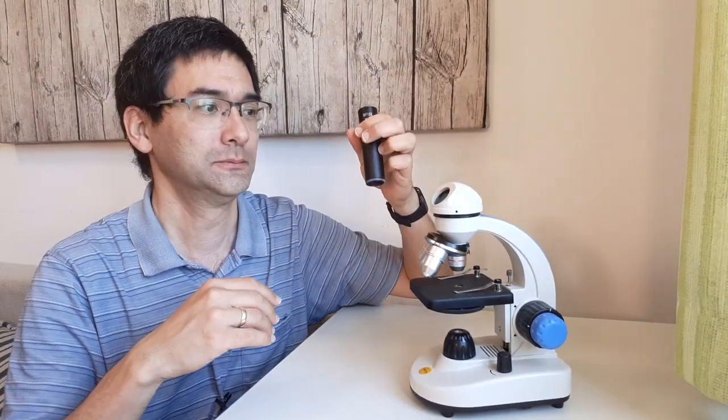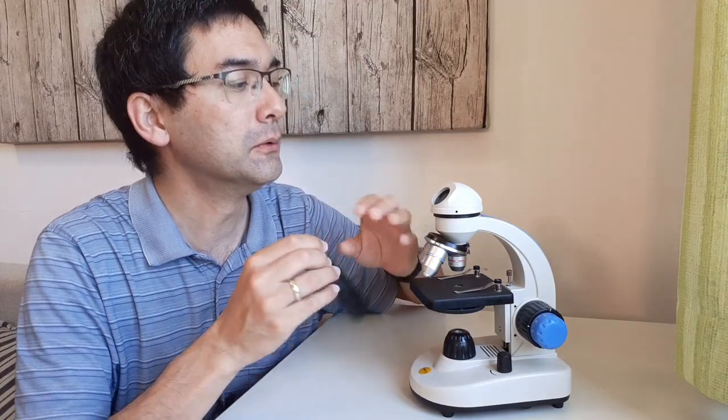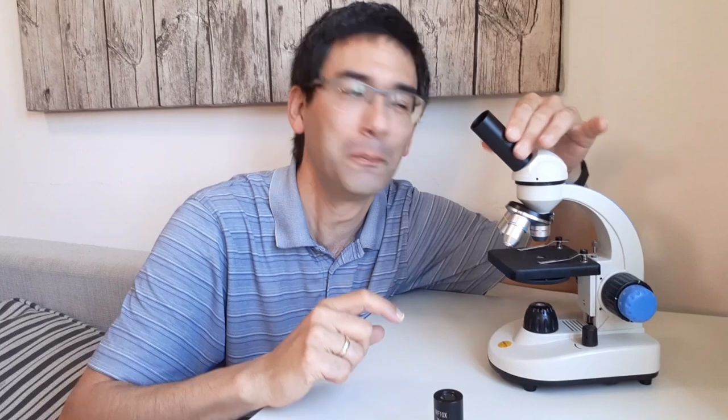So hi, hello and welcome. Microbe Hunter here. I'm going to show you today in this very basic introductory video how you can use a microscope. I'm going to give you five tips on microscope use because these are five common problems that I've seen beginners make and we're going to get started right away.